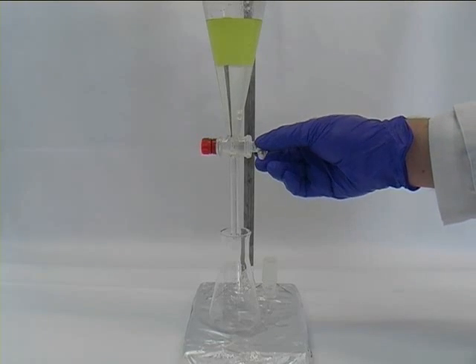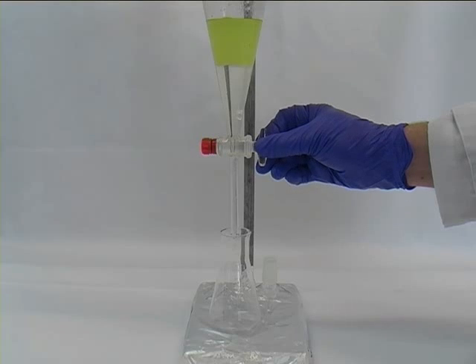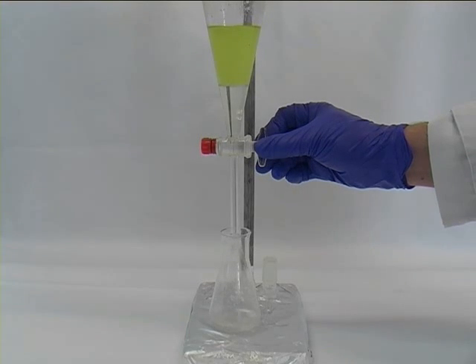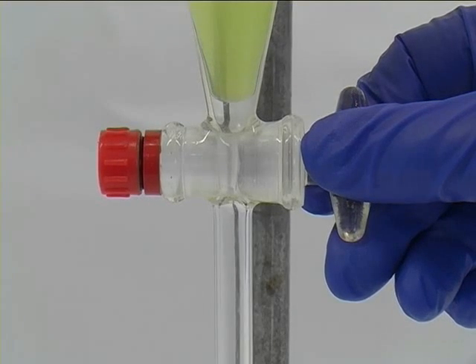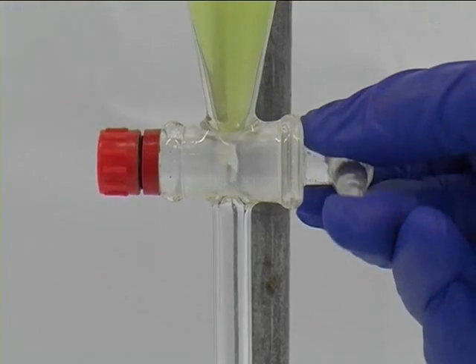Now we run out the lower layer and do that carefully towards the end of the process, and stop it in time before the upper phase arrives.